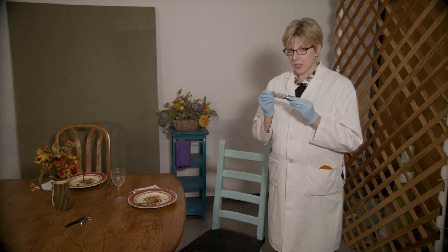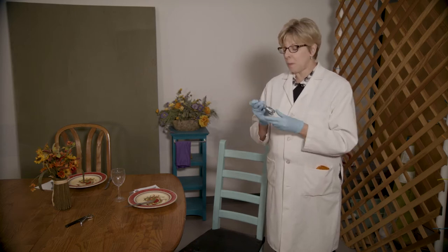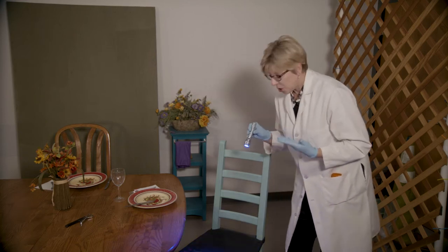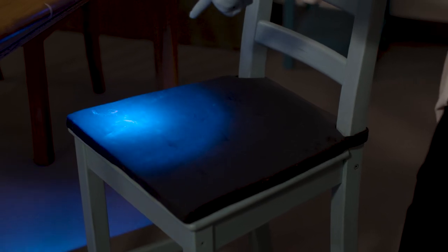This particular alternate light source produces a blue light. Other alternate light sources can produce different wavelengths of light. But for now, we're going to use this blue light and demonstrate how much more detail you can see at a crime scene with just this different wavelength of light. You can see here this trace evidence, this pink fiber, fluoresces. But this whitish area here is of interest — it looks a lot larger and potentially looks like some type of pattern that we didn't see before with just the flashlight.